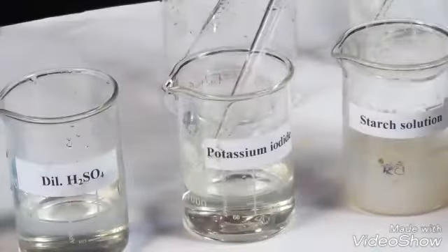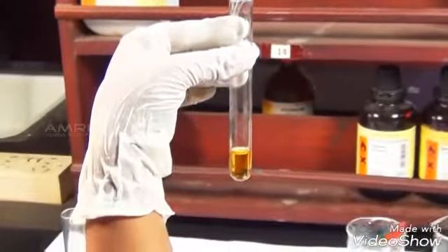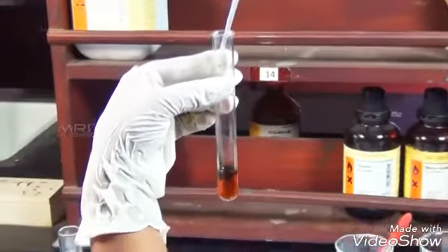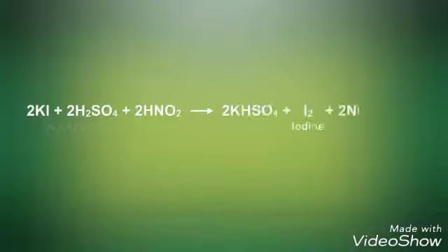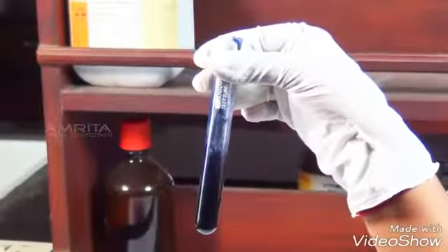Now, add a few drops of potassium iodide solution using a dropper. Then, add a small volume of freshly prepared starch solution using another dropper. Nitrite reacts with potassium iodide and dilute sulfuric acid to liberate iodine, and the liberated iodine reacts with starch to form a blue-black complex.